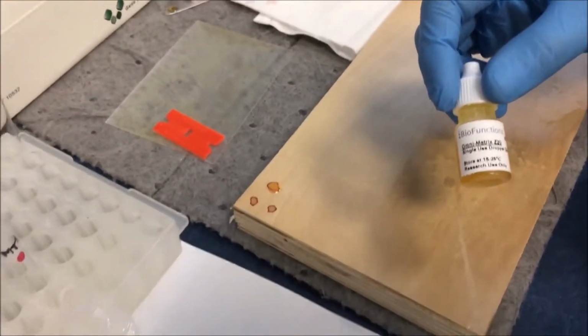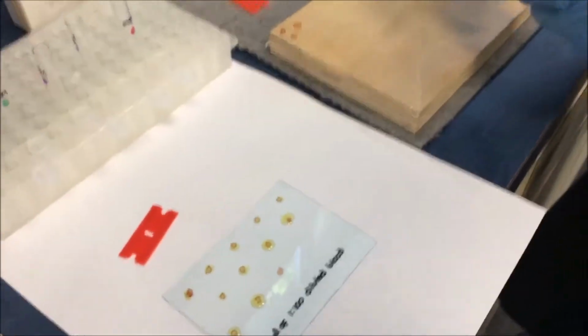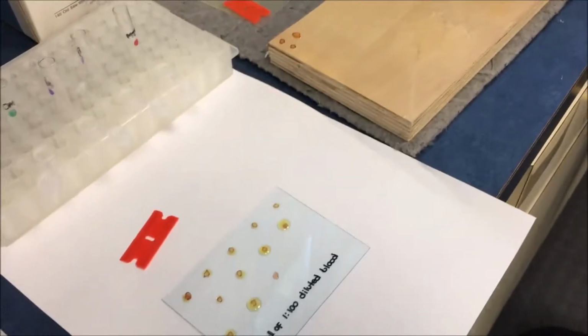The Omni-Matrix, either the spray or the one we deposited earlier on the non-porous surfaces, takes about 3 to 5 minutes to dry out. After they are dried out, depending on the humidity of the surface, they are then scraped off.